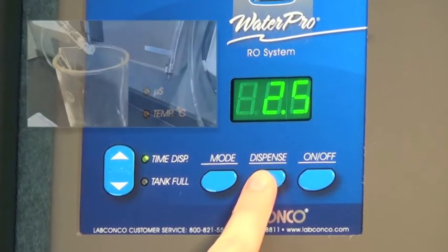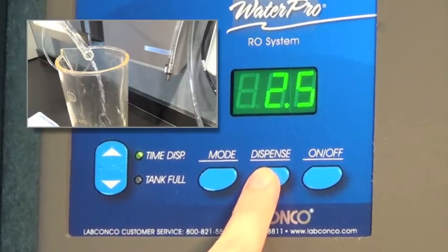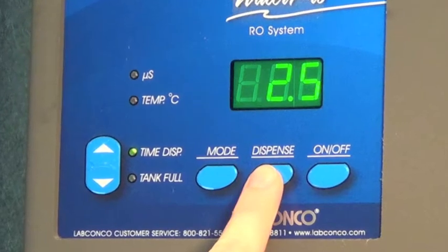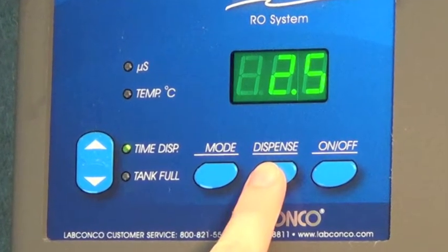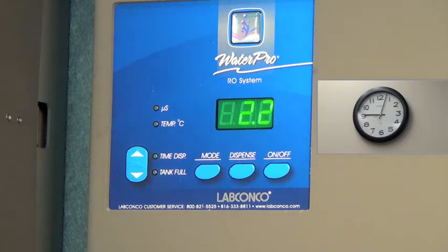Pressing the dispense key delivers water from the dispense valve. The key must be held down to continue dispensing. The delivery will be time controlled if that mode has been selected and a value entered into the display.